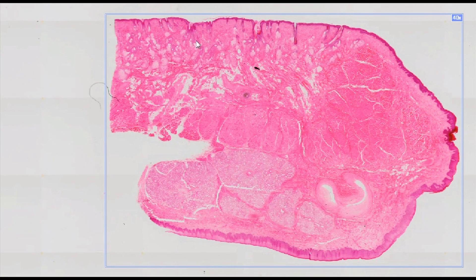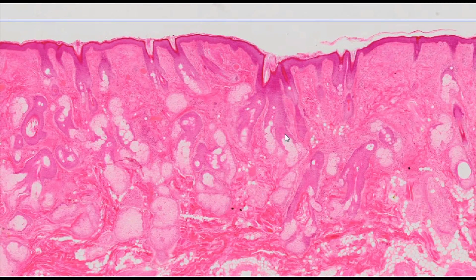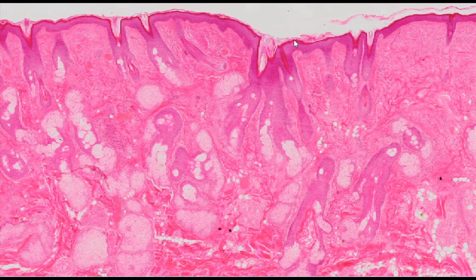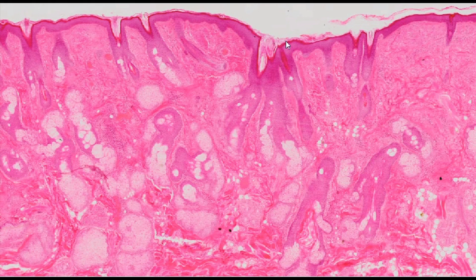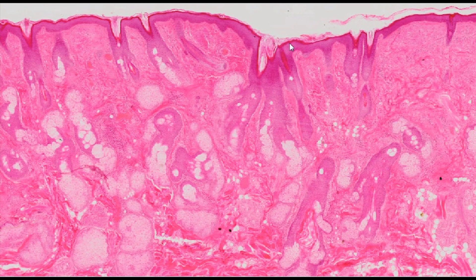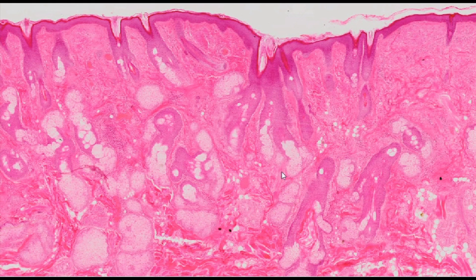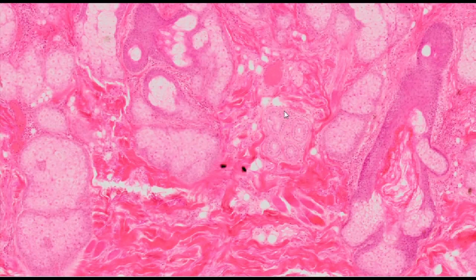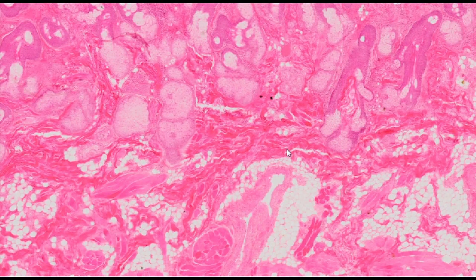The outer part of the lip is made of hairy skin, which comprises a fairly thin epidermis — that is, stratified keratinizing squamous epithelium — and underlying dermis with hair follicles, sebaceous glands, and sweat glands. The subcutaneous tissue, abundant in adipocytes, is the most internally located layer.